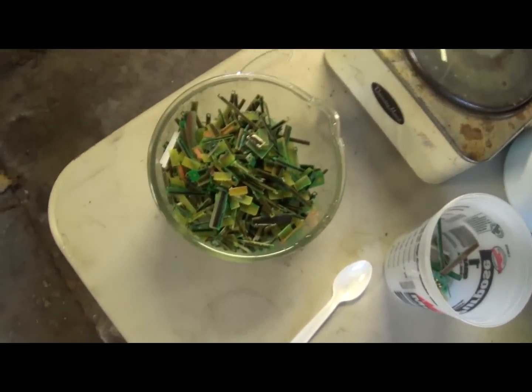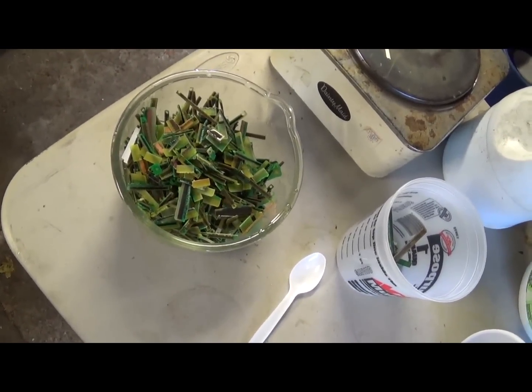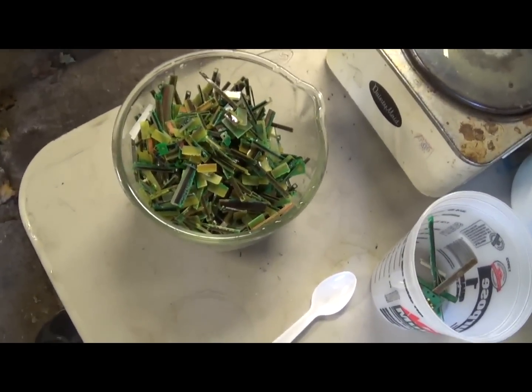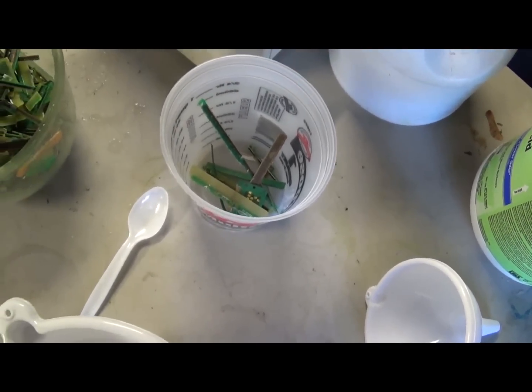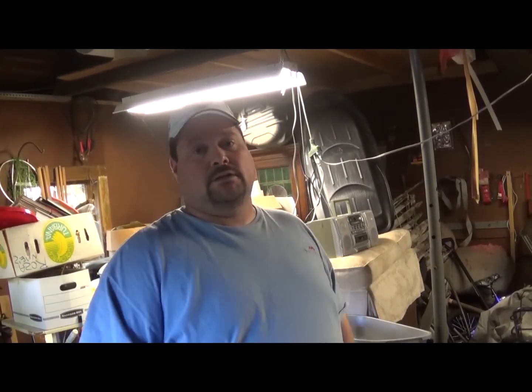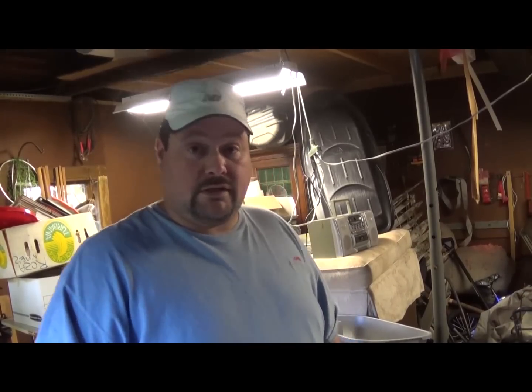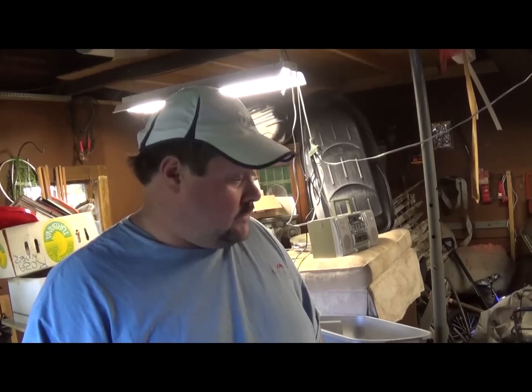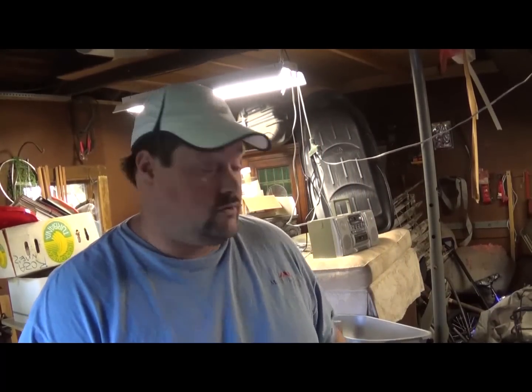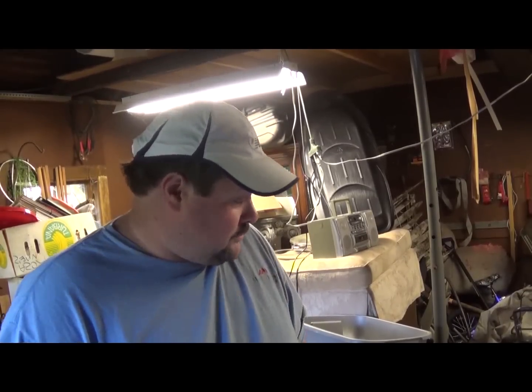I've got the rest of these fingers that I rinsed off as best I could. I'm going to let them dry off really well, and then some night when there's nothing on TV, I'll throw them all out on a cookie tray and go through them one by one to make sure none still have gold on them. If they do, they go in the next batch. That took me about two hours to get all the filtering done. My method may not be the best method, but that's the way I do it — I try to make sure I rinse everything really well and don't lose any gold. My acid peroxide is all back in this jug and I make sure to test it periodically with stannous chloride to make sure there's no gold dissolved in there. Using the air bubbler system, you really don't have to worry about that too much.